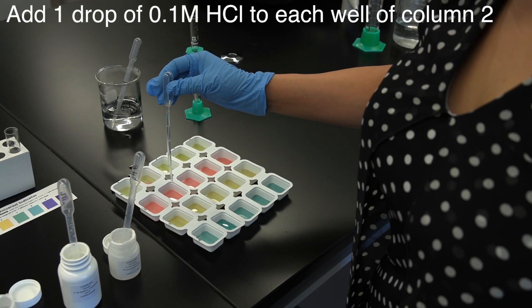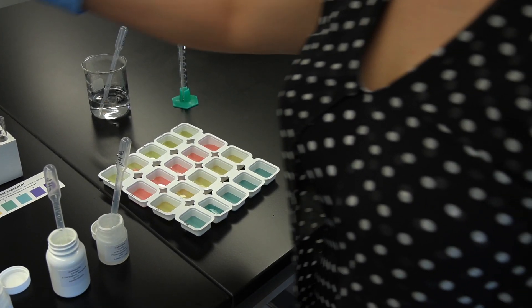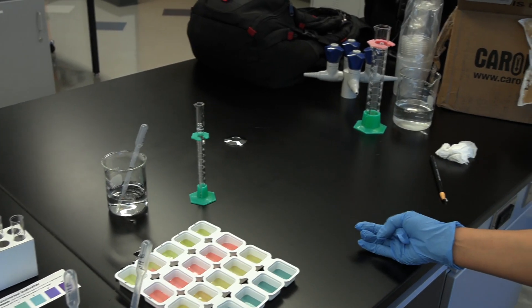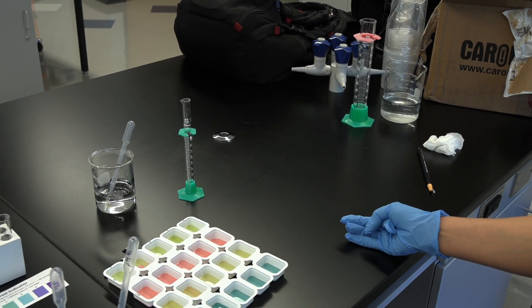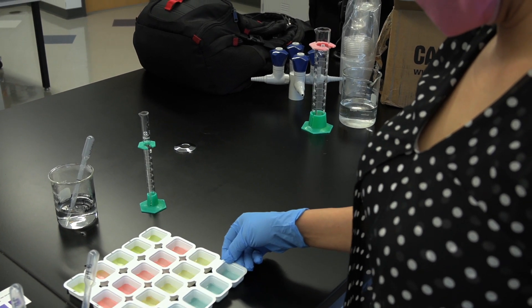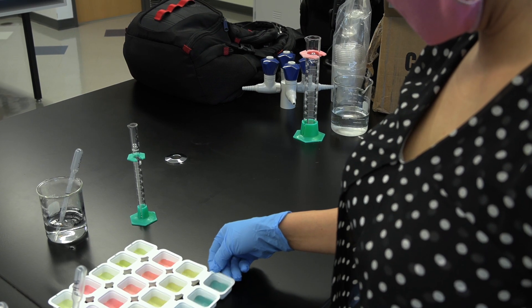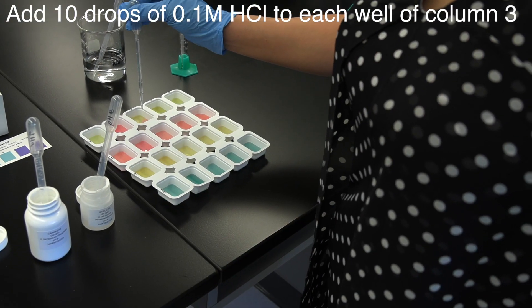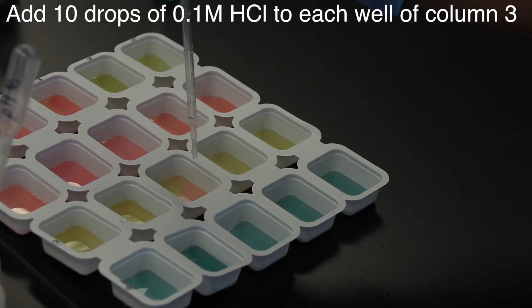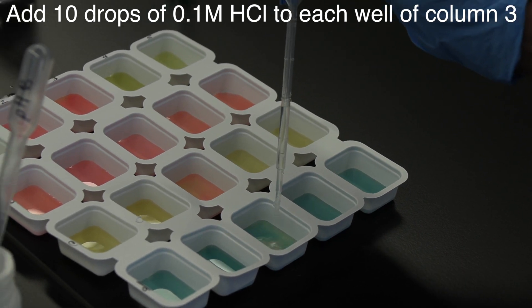In the second well of each row, column 2, add one drop of 0.1 molar hydrochloric acid using the designated dropper pipette. Gently swirl the solutions and record the resulting pH of each solution in data table 1. In the third well of each row, add 10 drops of 0.1 molar hydrochloric acid, again recording the corresponding pH in data table 1.